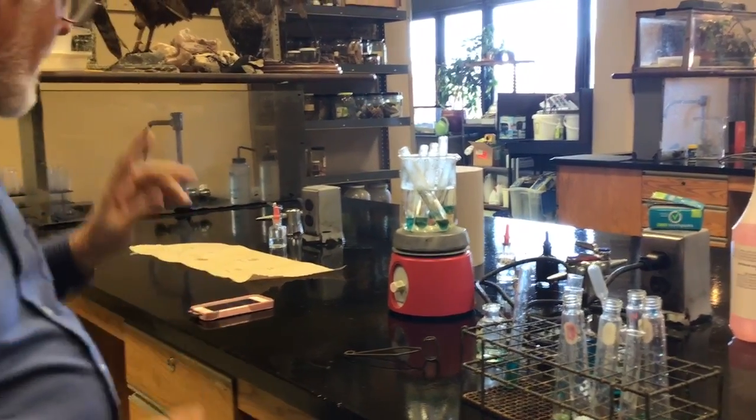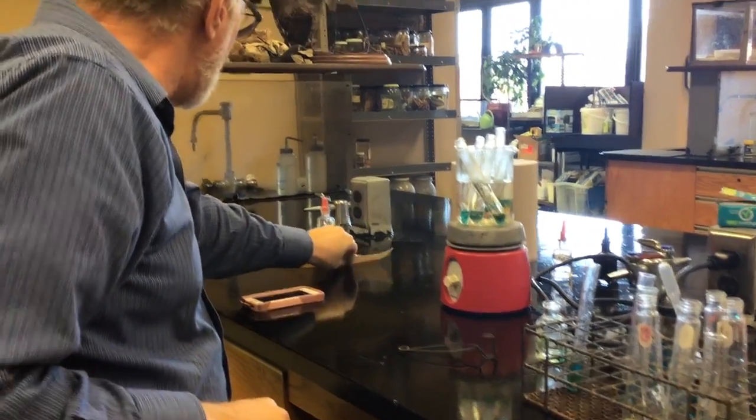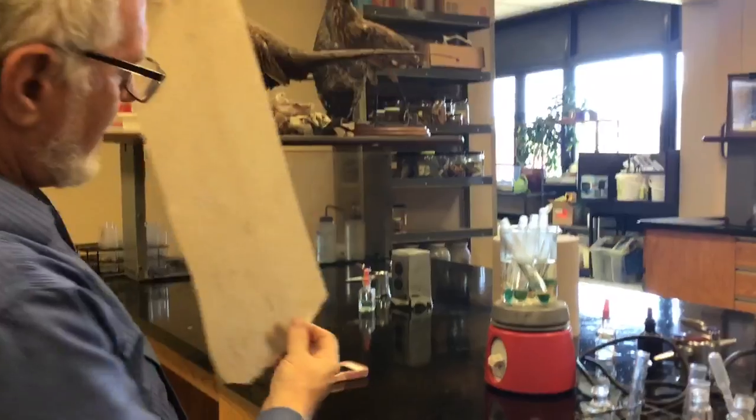While we count down for the three minutes, this is the paper we did the spots on for the grease spot test. The question is: did the stuff evaporate, or did it leave a wet spot? And the final question is, does the light come through it? You want to be below it so you can see if the light comes through. So now that you've figured out what spots still have light come through, see what they're labeled.